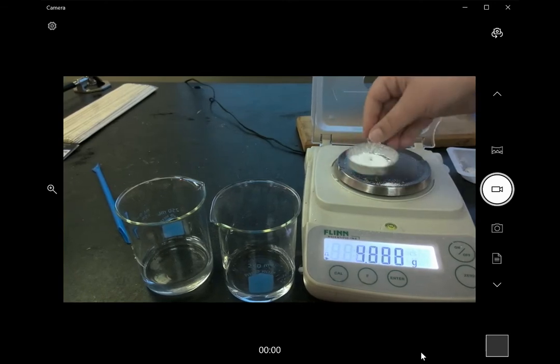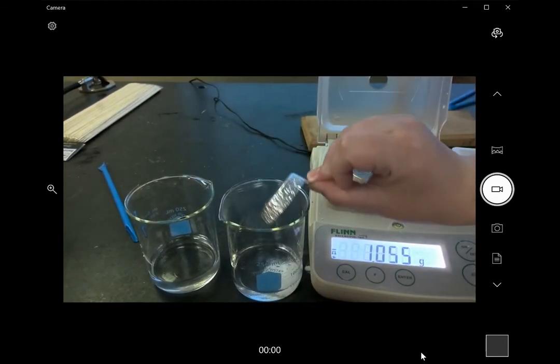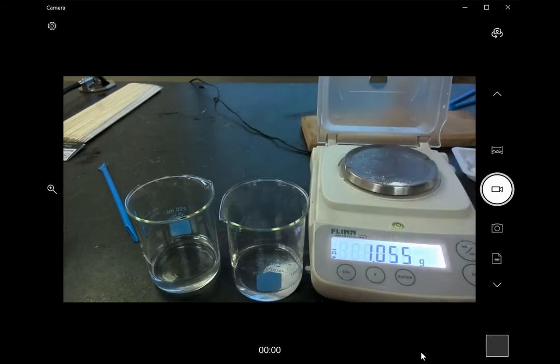And I'm just going to pour this into my first beaker of water, which already contains 50 milliliters of distilled water.